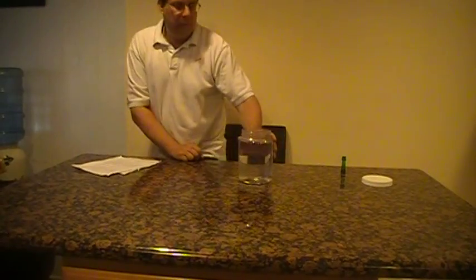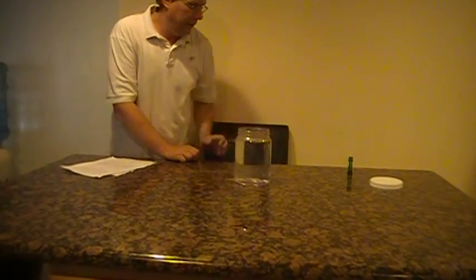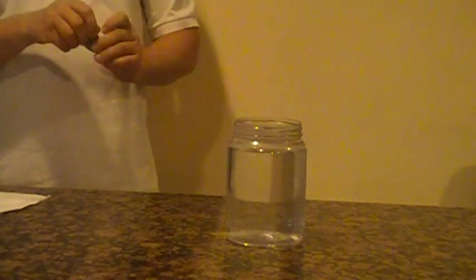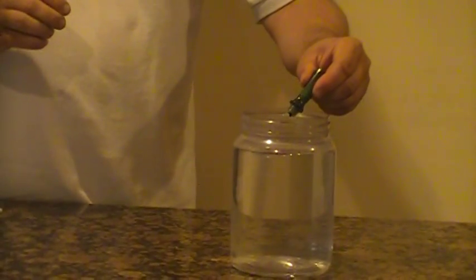Now for this video and the first part of this experiment, I'm going to be focusing on diffusion. So how I'm going to do that is I'm going to take this jar of water, and I'm going to add about three drops.